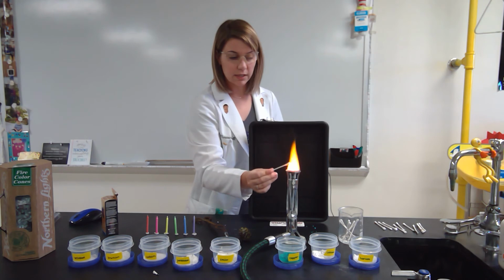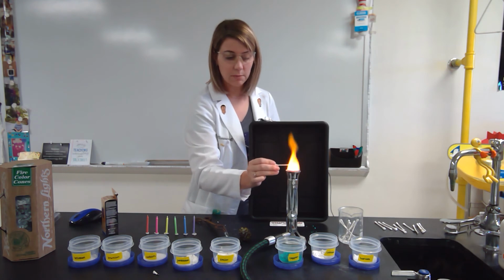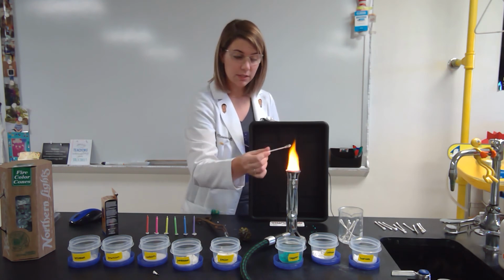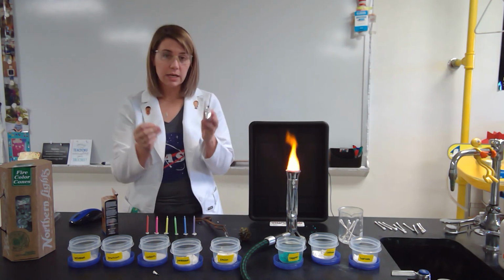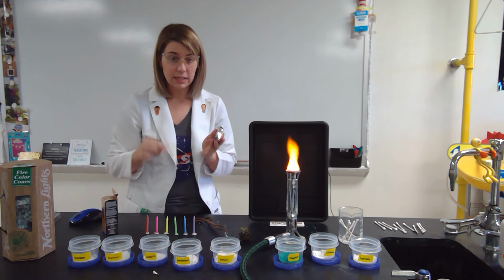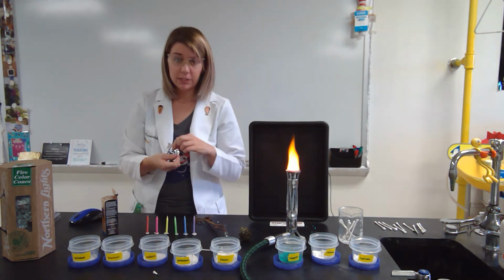So if I put this in here, I see some of the green coming off, I see some of the pink and purple coming off, so I see some potassium in there, some copper, I do see some red. So the funky colored flames that you would see at a hardware store, that people like to throw into their fire pits, are also containing the same types of salts for you to burn and essentially change the color of the flames.